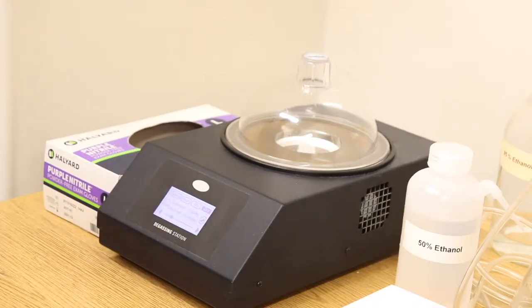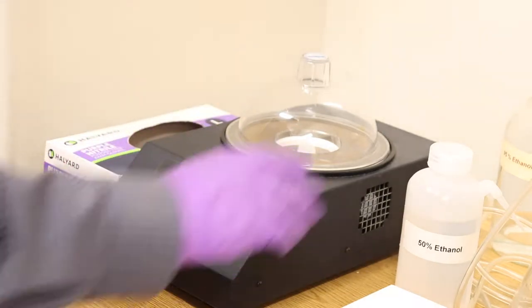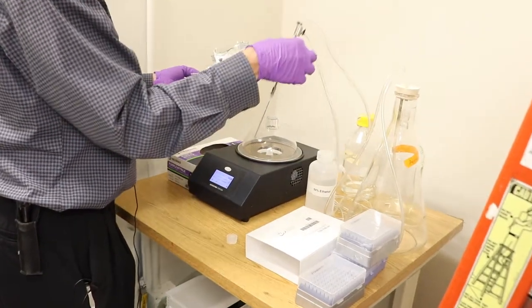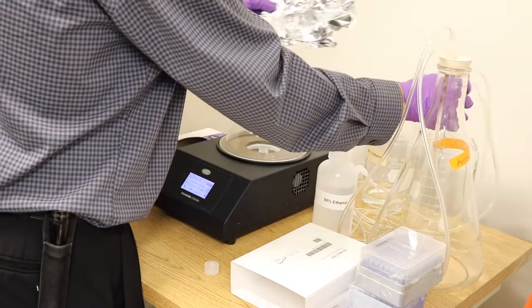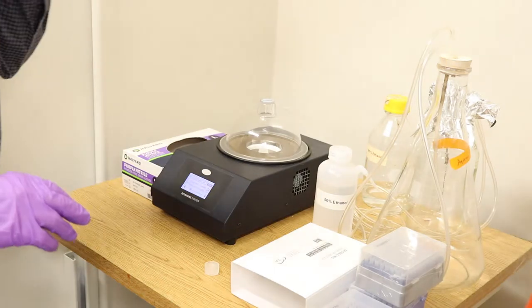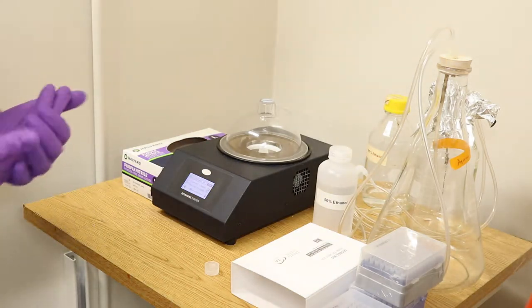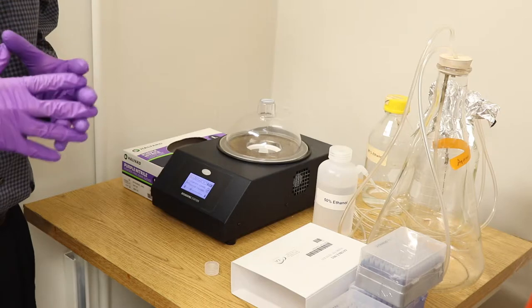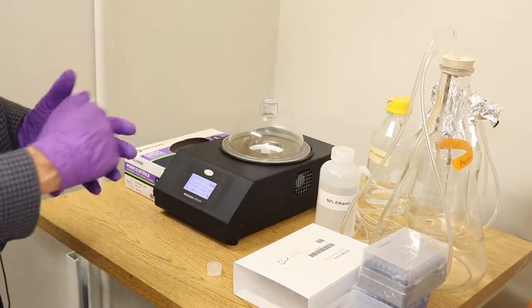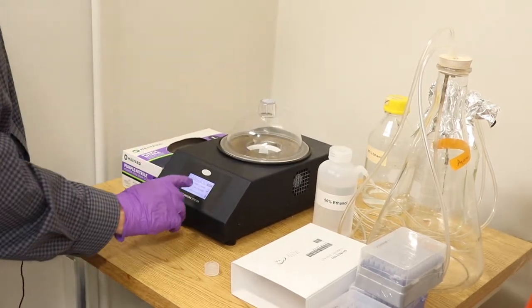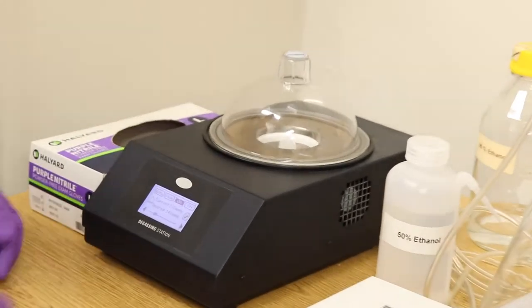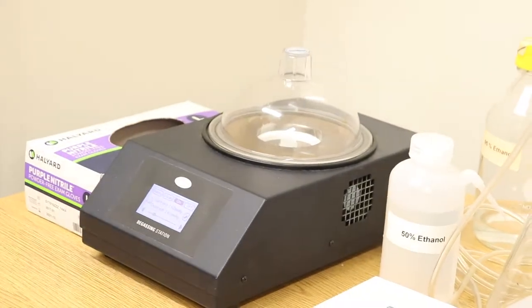If you get to the point of using that, you're in trouble. Something bad happened. Most likely your sample precipitated when it was in the cell. And there's ways around that to prevent that from happening. I'll get to that when we get to the actual sample. So I'm going to turn the degasser on. Okay. So we'll wait about five minutes. Okay. So after five minutes, we'll stop the vacuum.